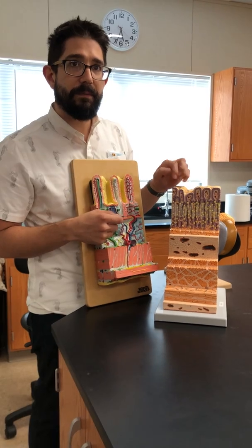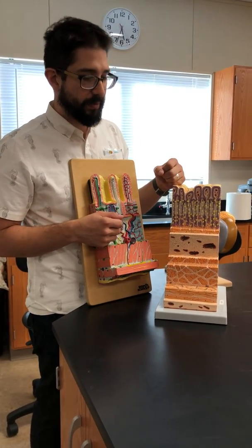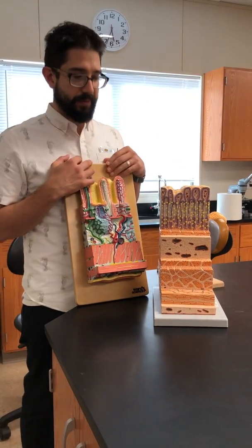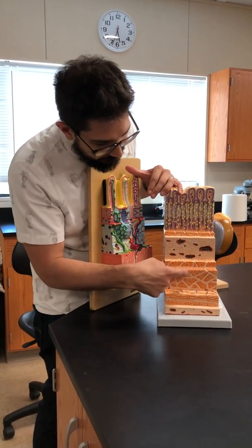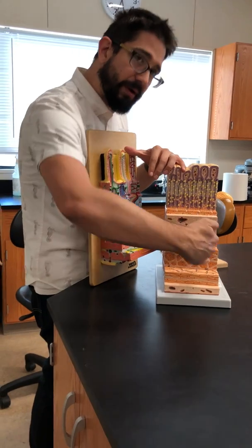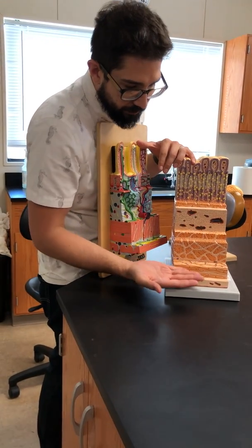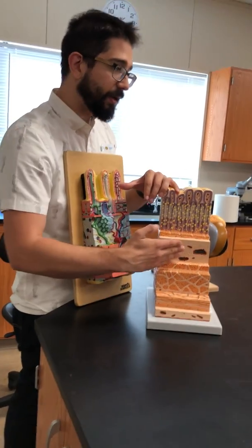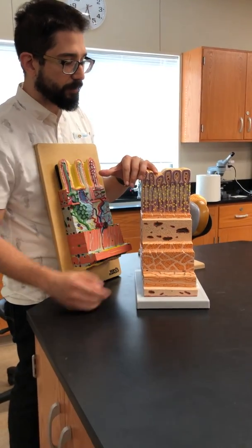And the three muscles are longitudinal, circular, and oblique. Correct. So which one do you think is oblique? This one, the small one, because you can see these are cut, they're coming right towards you and got cut, and these are going longitudinally, this way, and these are at a diagonal, the oblique layer.